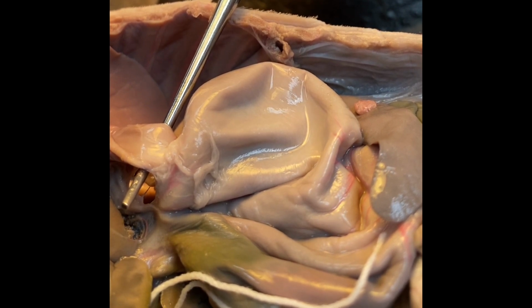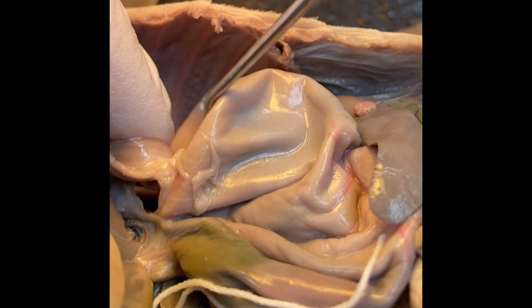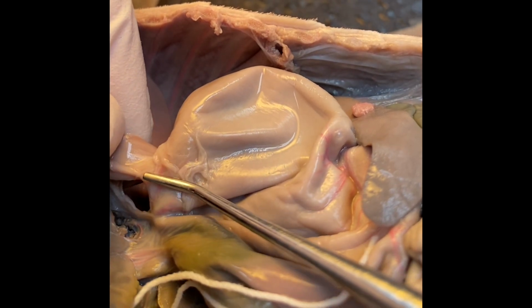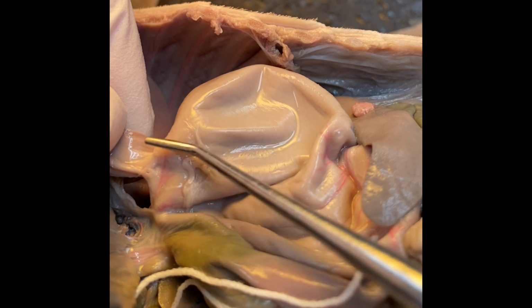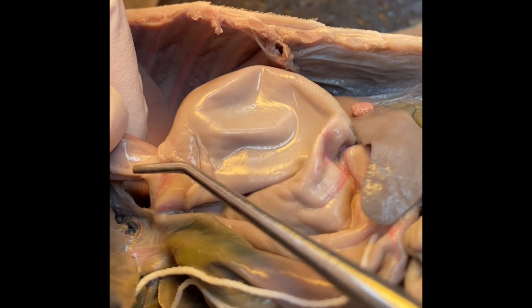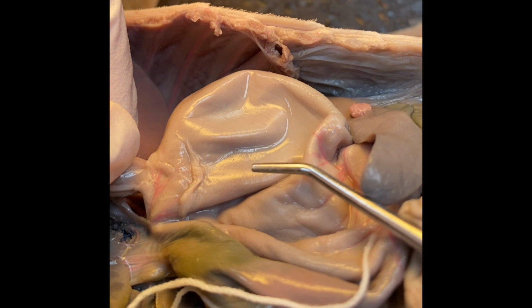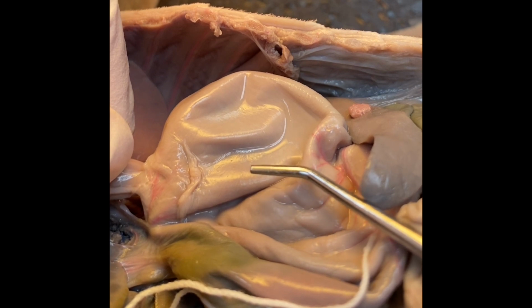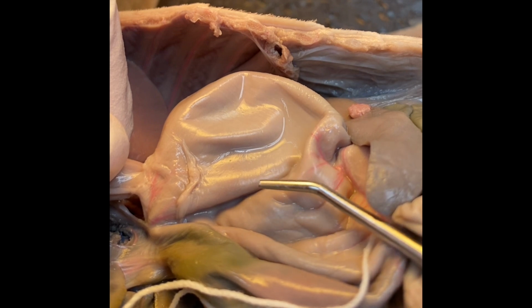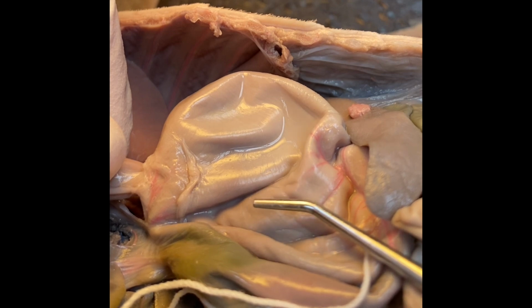After we swallow a bite of food, it travels through the esophagus and it will enter the stomach through the cardiac valve or cardiac sphincter. A sphincter is basically a circular band of smooth muscle that encompasses the opening, and it can control how much food gets in and prevents backflow of food. Inside the stomach itself is where mechanical digestion begins. It's where our food physically is churned and mixes with water, with mucus, with hydrochloric acid, and protein digesting enzymes.